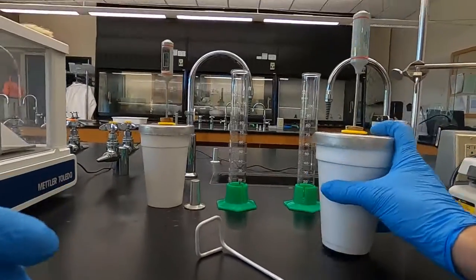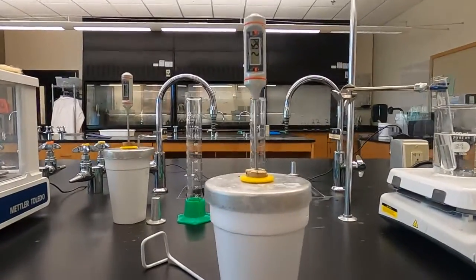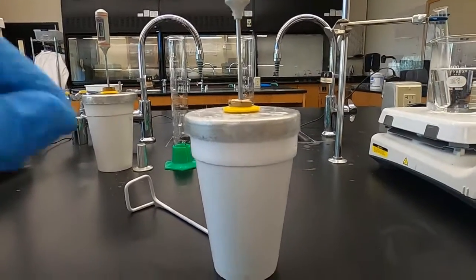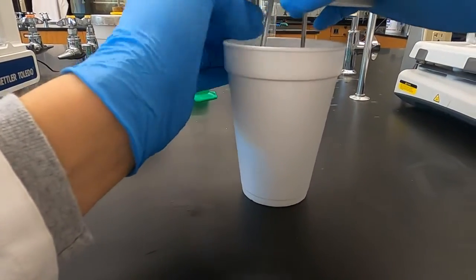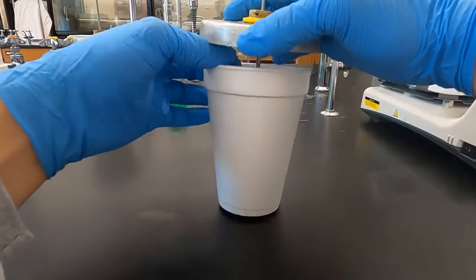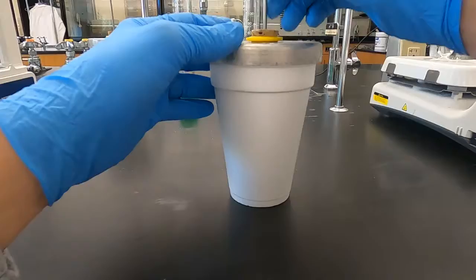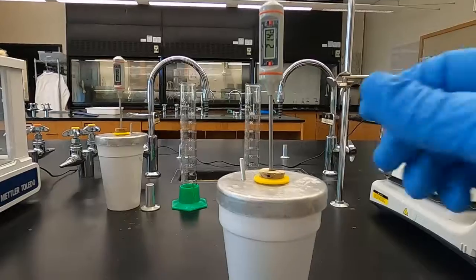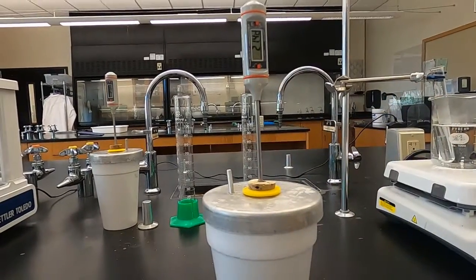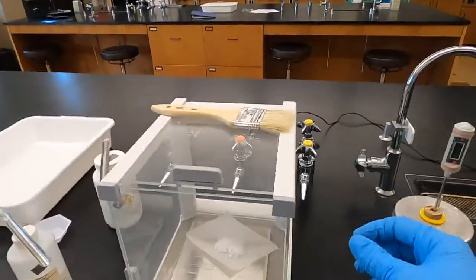So again, I don't want to cause confusion. This is calcium chloride. We just did the ammonium chloride. Now I'm doing two parts kind of simultaneously. 21.5 degrees Celsius is our initial temperature. That's on par with what we're expecting. Water came from the same place. It's actually 21.4 degrees Celsius. I'm gonna check one more time before we pour this in, but it should be fine.